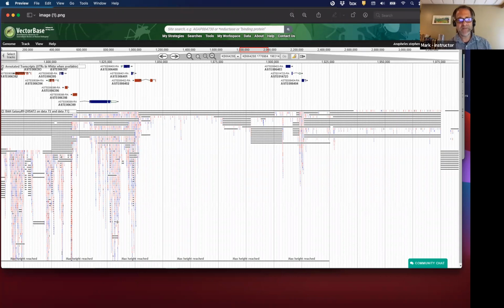And you know, we see there's a lot of alignments, and it's usually around genes. There's blue and red, so it's aligning to both strands. This is not a strand specific experiment, and I could sort of tell that because there's blue and red reads around this gene. And I would say it seemed to call introns a little too promiscuously. So maybe that's something to think about as we rerun this. Maybe we want to set a more stringent cutoff for when to call introns. But anyway, the point is that you have access to these files, and you can look at them and judge whether they're high quality.